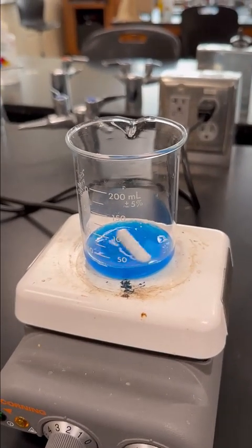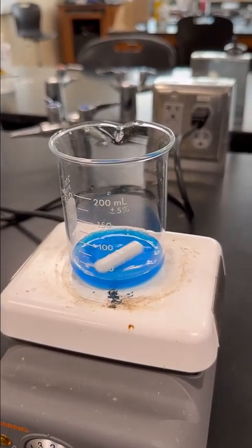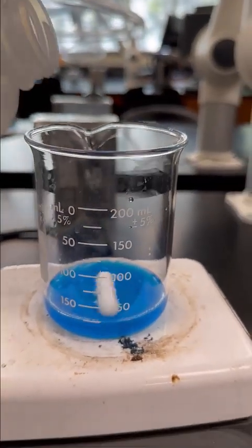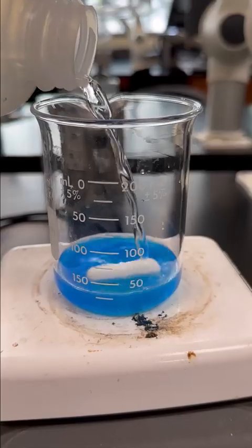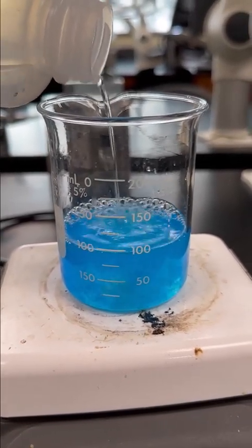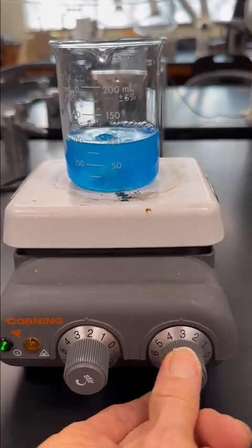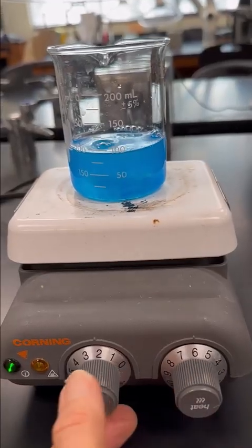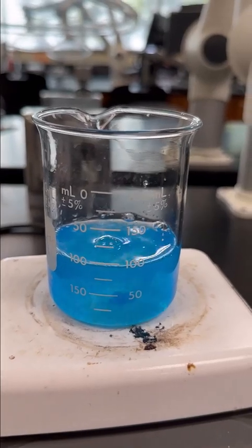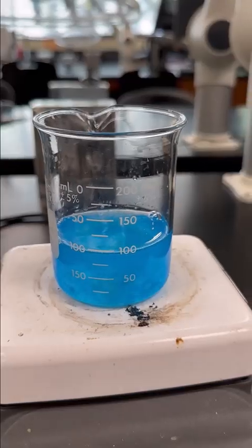All right, from step 2, we made our copper hydroxide, which we now need to convert into the copper oxide. So we are going to dilute our sample first up to 100 mL. We're just going to pour water in, and this doesn't have to be really accurate. We just need it to get up to about 100. And we are going to turn on the heat on our hot plate. I'm going to put it up here at 6. And we are going to see what happens over time. Yep, I will come back in a few minutes after the reaction has started to heat up.